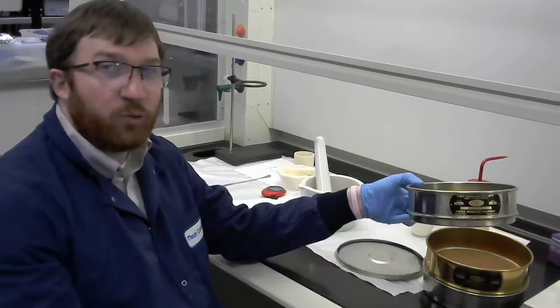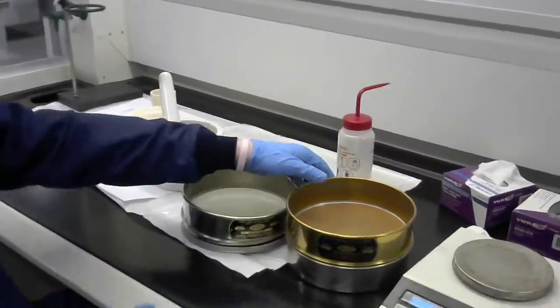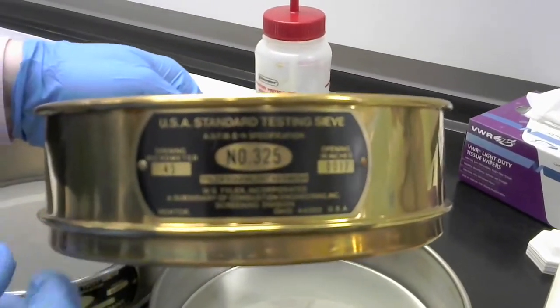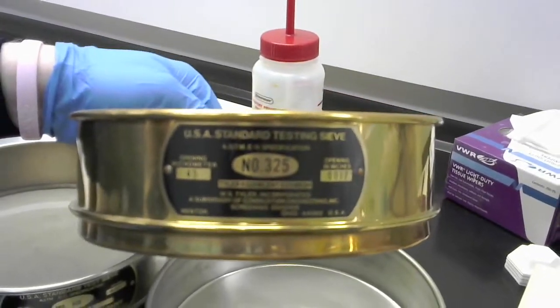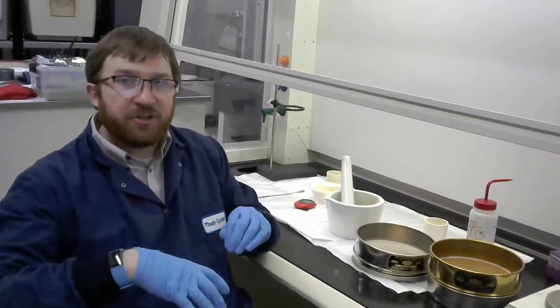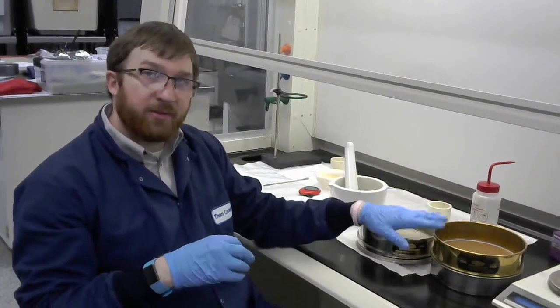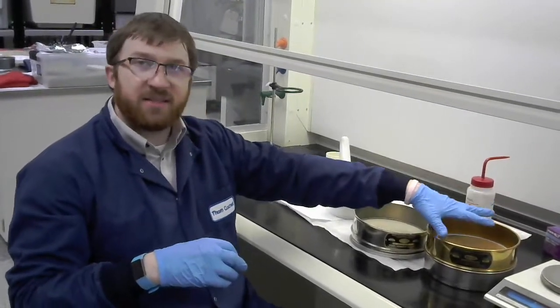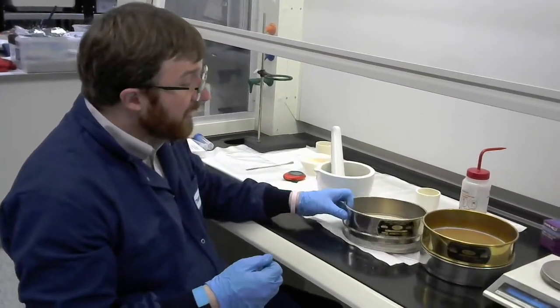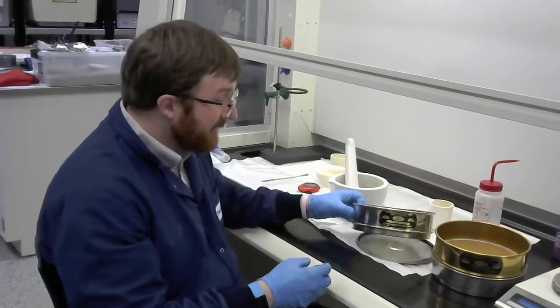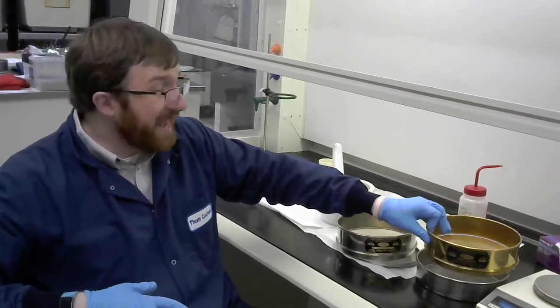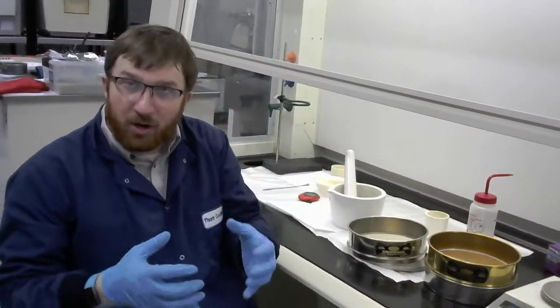So if I have 80, that is one size opening. And then the next one, this is the one I mentioned in the video, this is the 325. So this is the important one. Once the powder can pass through this opening size, this is a good condition for us. A lot of powders you buy from companies will say 325 mesh. So that means that it's gone through this mesh. So that's, again, the cross-hatch is just known as mesh. So we'll put, we'll basically stack these. So I'll put the 80 on top, the 325 on bottom. Again, I strongly recommend looking up what the sizes are so you know approximately how large your powder is.